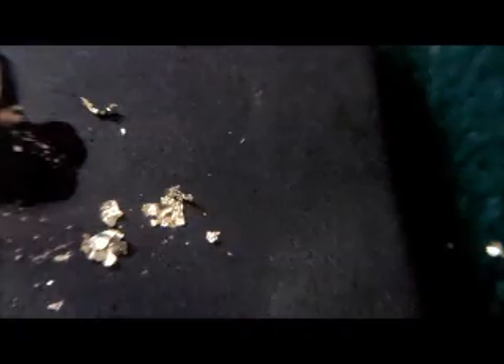Amazing. It should be eaten all up by now, but there are some traces — maybe 10%, maybe 5% is sticking around. So let's use our 10 karat sample and see how fast the gold deteriorates in the acid compared to the 10 karat scratch marks. I moved some of the acid over there and we still got some gold flakes in there that are sticking around. Let's put a new flake in and test that one. You can see the acid is still eating the stuff, but it's not going really fast. So there's something in there.